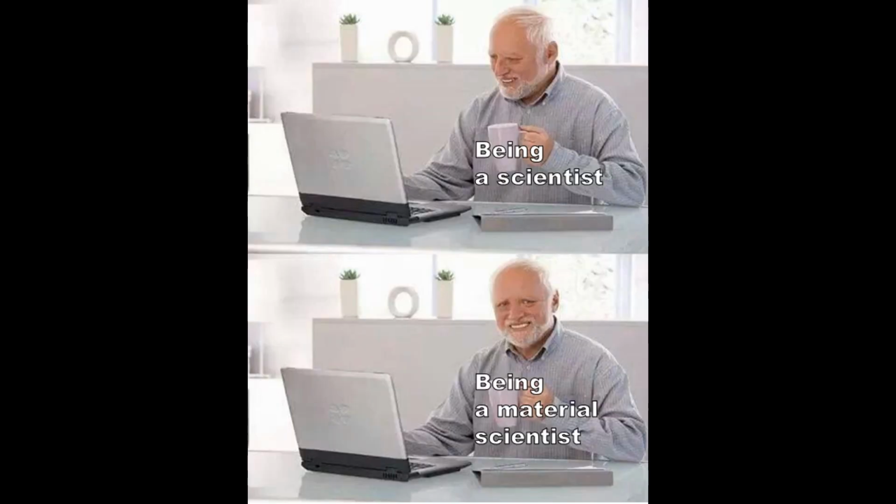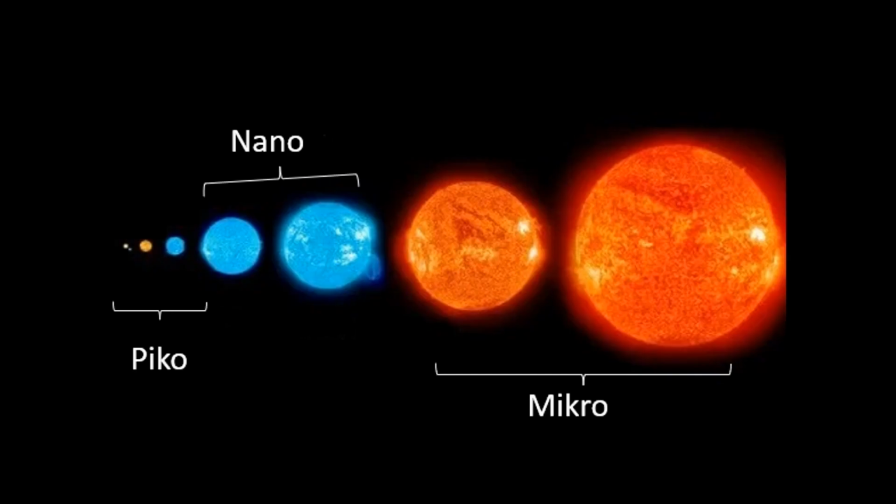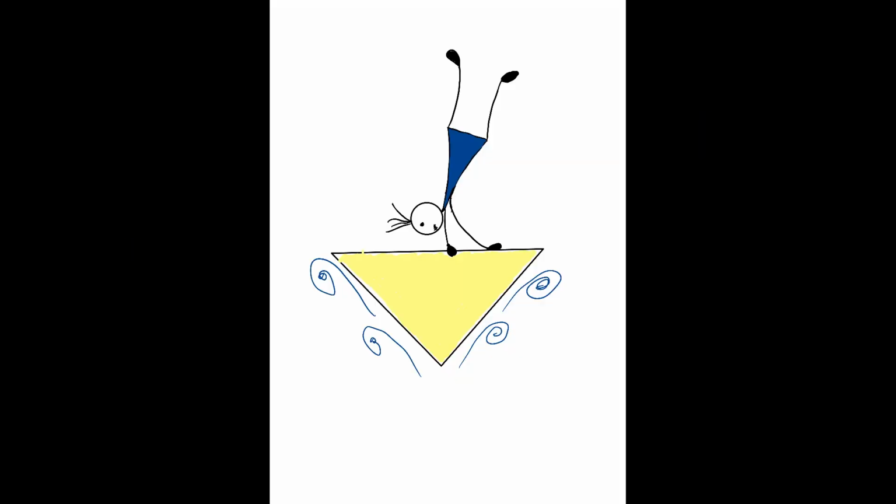This is Bob. He is a materials scientist in the field of indentation. Especially, he loves nanoscale experiments. He is performing some tests at this very moment. Hey, you're probably wondering what I'm doing here. Prepare for impact.